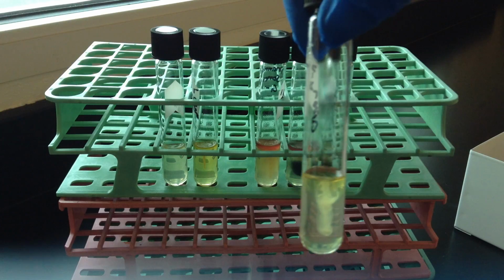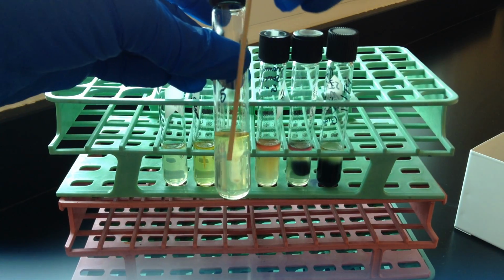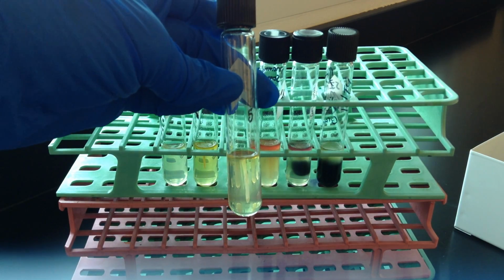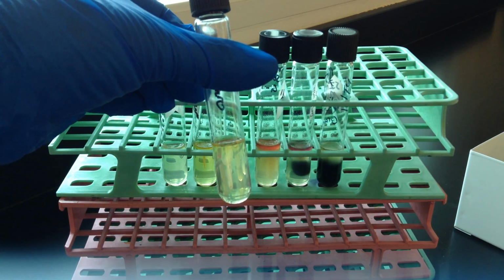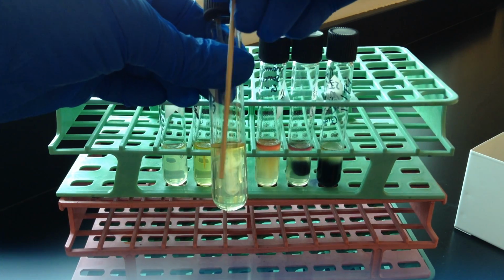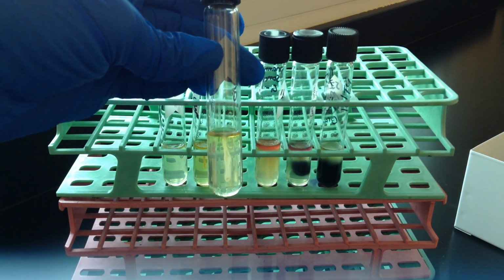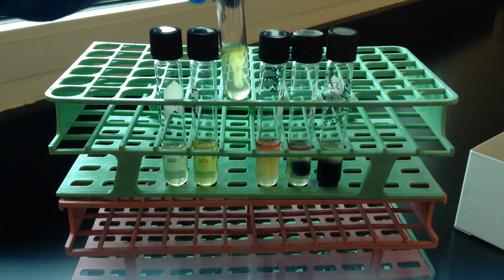So what's probably happened here when the inoculation was done, there's a little bit of movement of the needle, and that's very, very common. So please make sure that you really look out for a truly motile organism where when you turn it, you can see that it's moving in all directions. This one does not. It only is moving where the inoculator would have moved their needle a little bit when we put it in. As soon as we turn it, we see that it actually does not truly move away from the stab. It's just growing on the stab line.